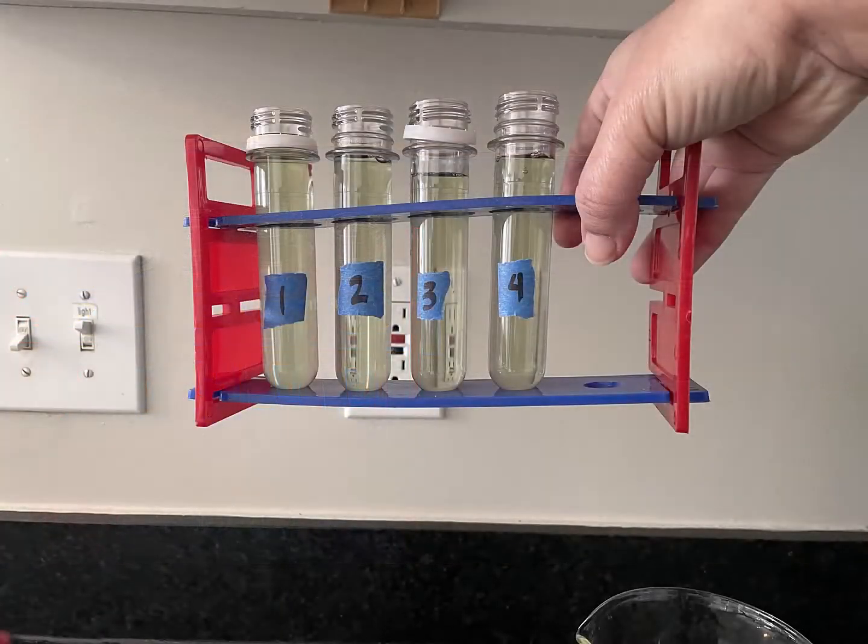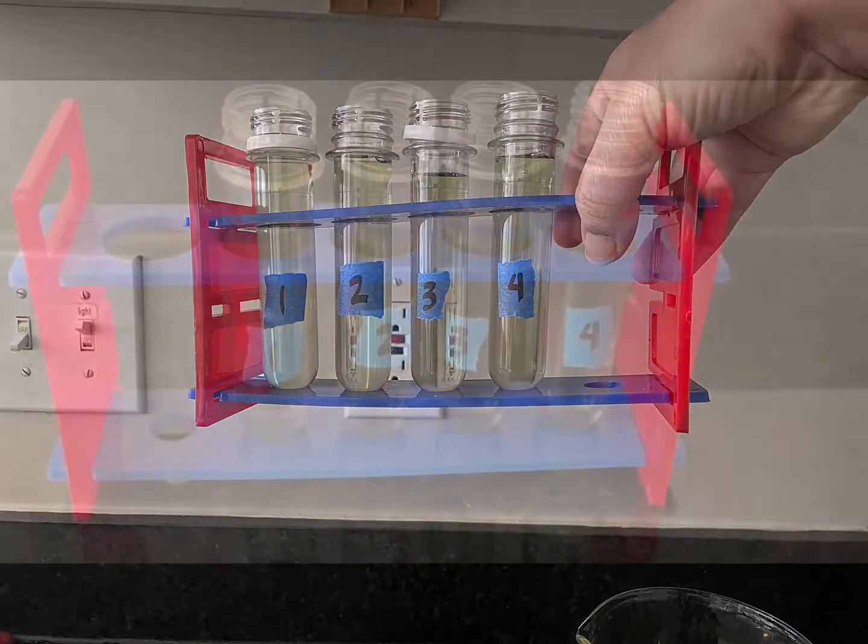You can see that all four test tubes have that light green color to them.